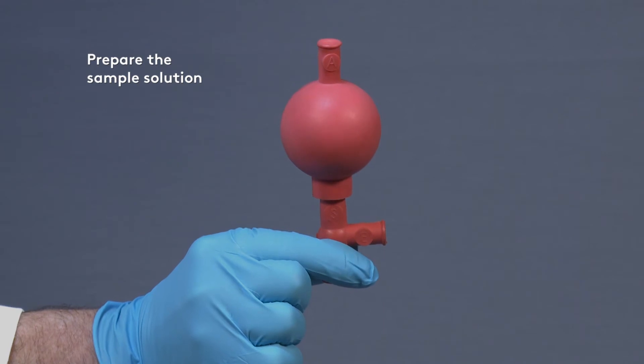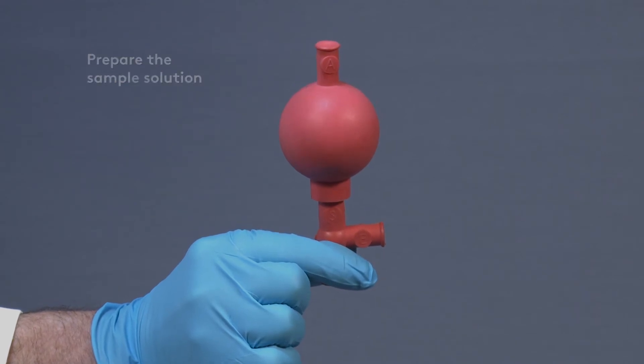The volume specified in the product datasheet. Take the Peleus ball. The valves A, S, and E perform various functions.